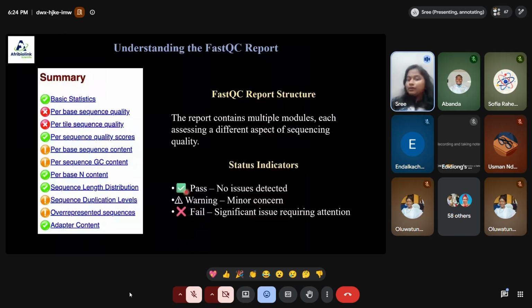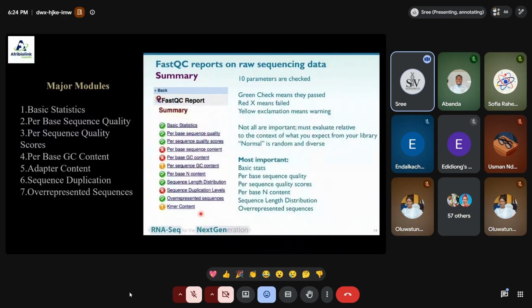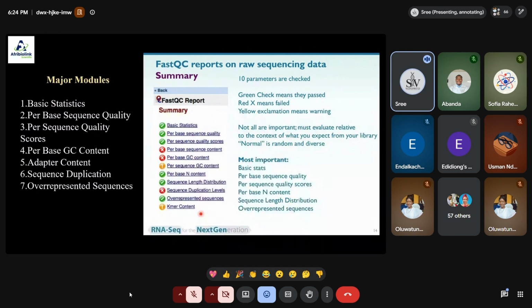If it is a green tick mark, there is no issue in detection. If it's a warning symbol, it means a minor concern. If it is an X symbol, a significant issue is there. We need to give proper attention before we perform the analysis. Okay. So that is all the information it holds, right?